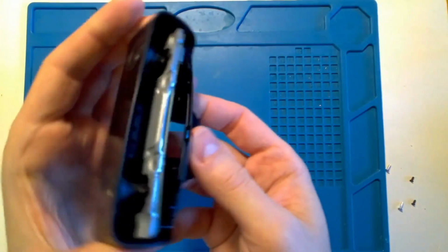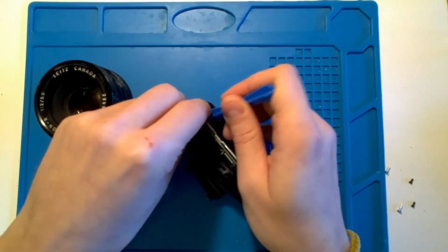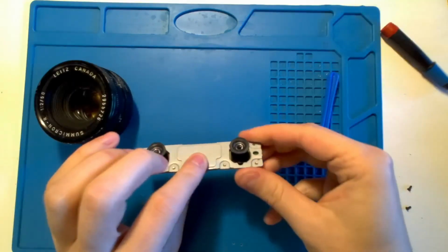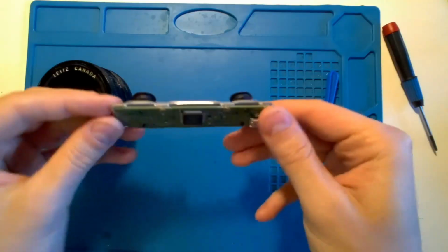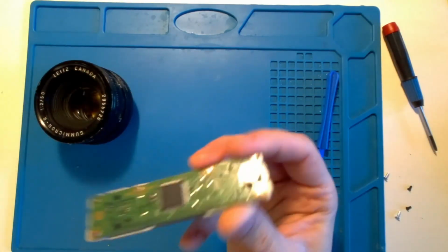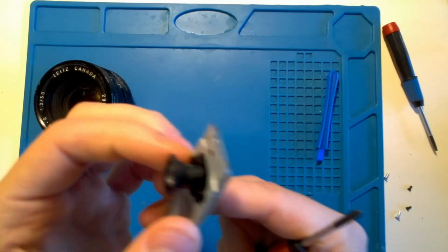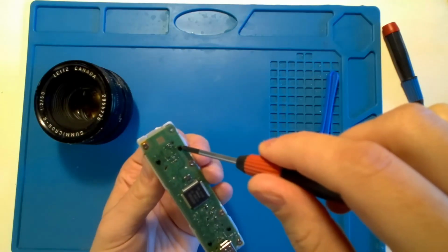You can see you have to bend those plastic pins to be able to pull on them. And the second one. These are the two cameras. Also at the back there is the chip. Now we can actually unscrew one of those lenses. They are mounted with those two screws at the back.